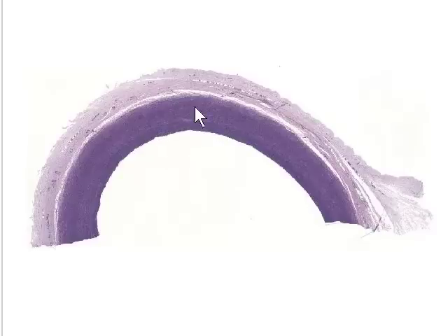So tunica intima, tunica media, which is made up of smooth muscle, which is sandwiched between layers of collagen and elastic fibers, and a tunica adventitia, which is the external connective tissue coat. And we'll increase magnification now, and we'll take a look at each of these layers in succession.